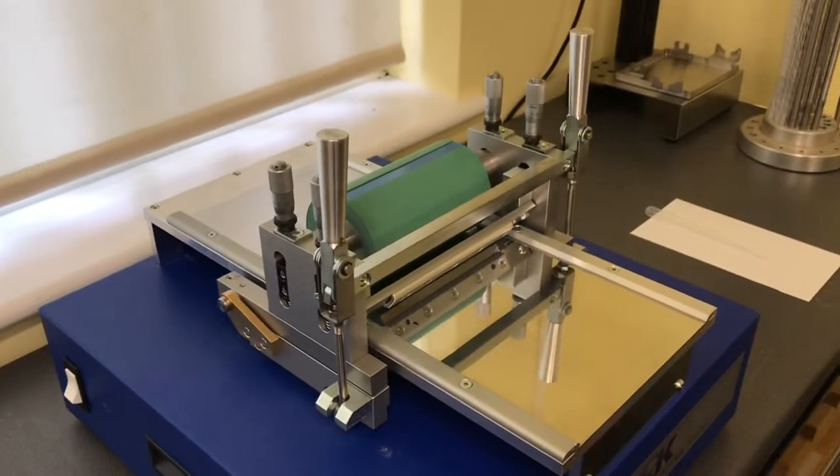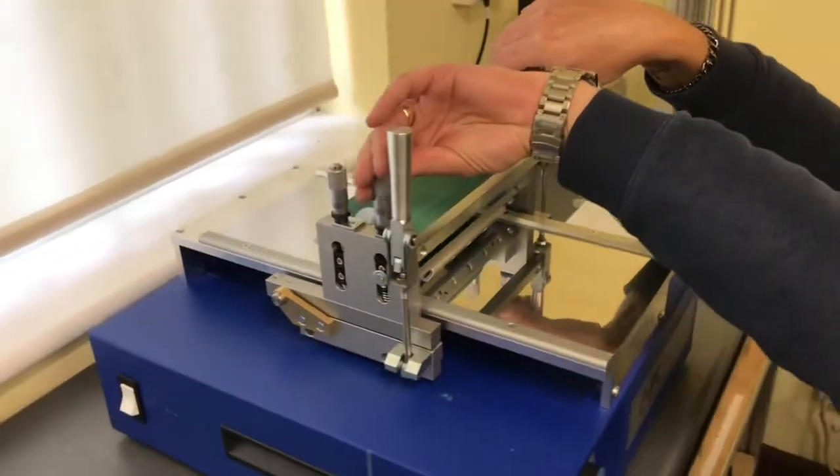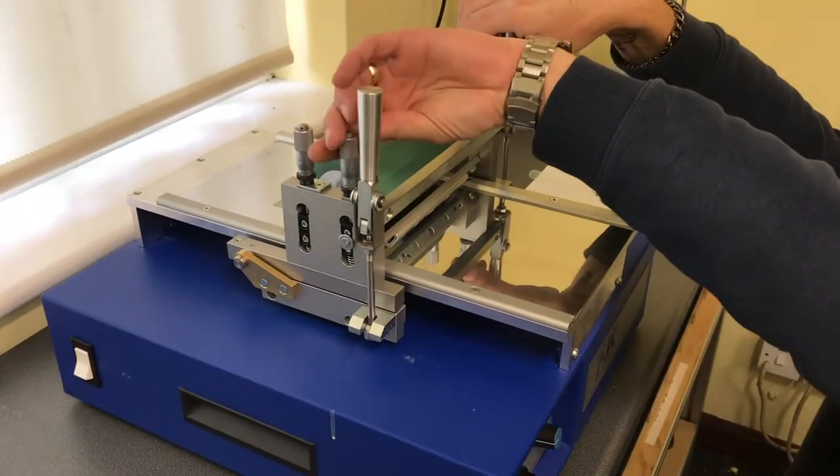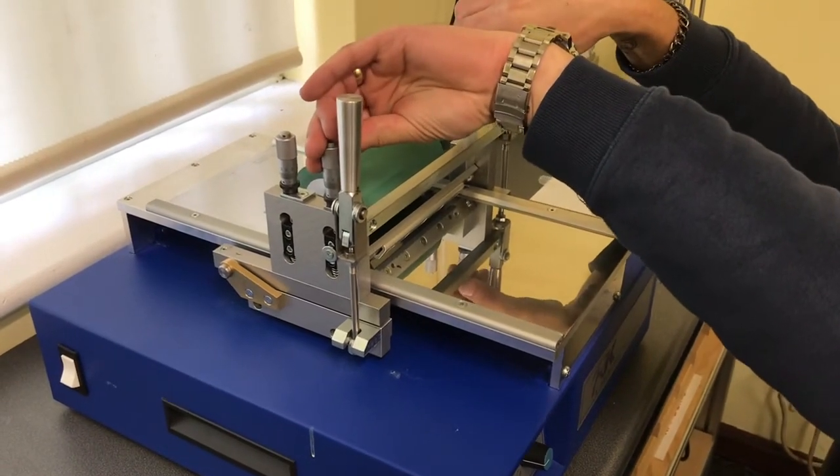Now do the same with the Dr. Blade. This was harder to see.